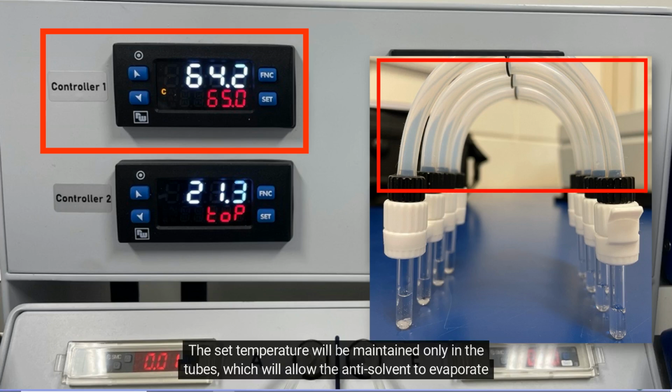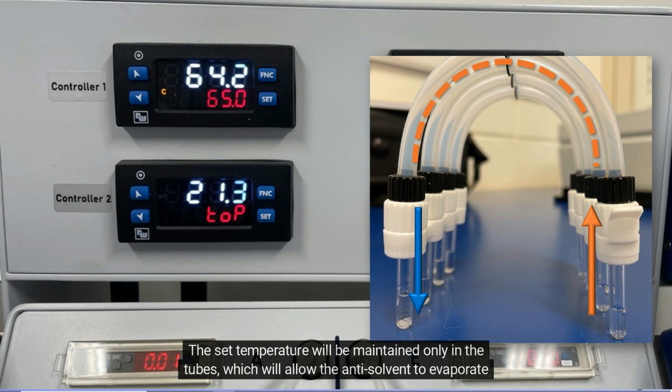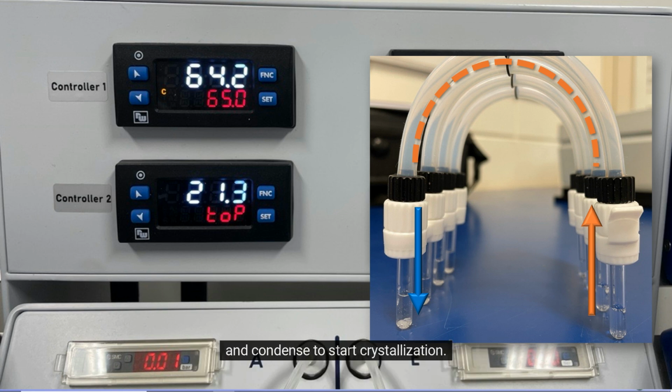The set temperature will be maintained only in the tubes, which will allow the anti-solvent to evaporate from one set of vials kept at higher temperature to the other set of vials kept at lower temperature and condense to start crystallization.